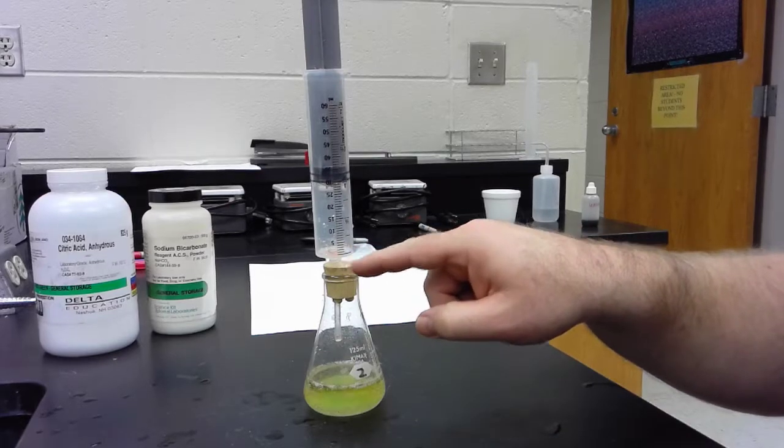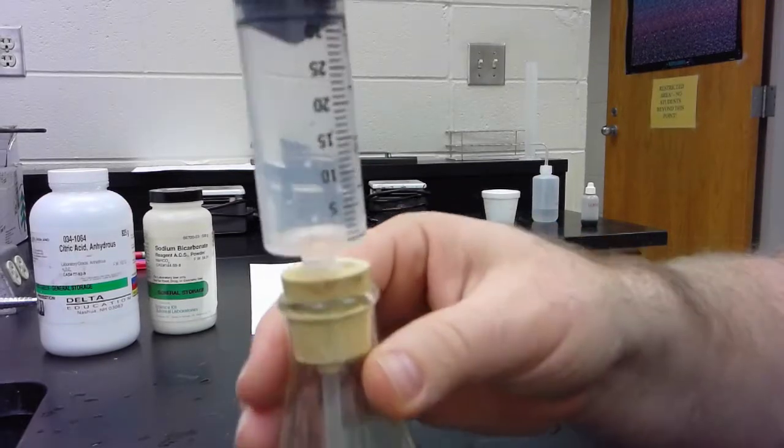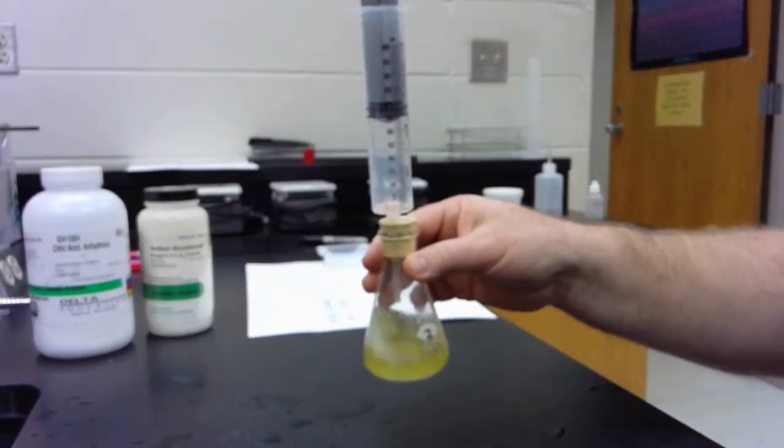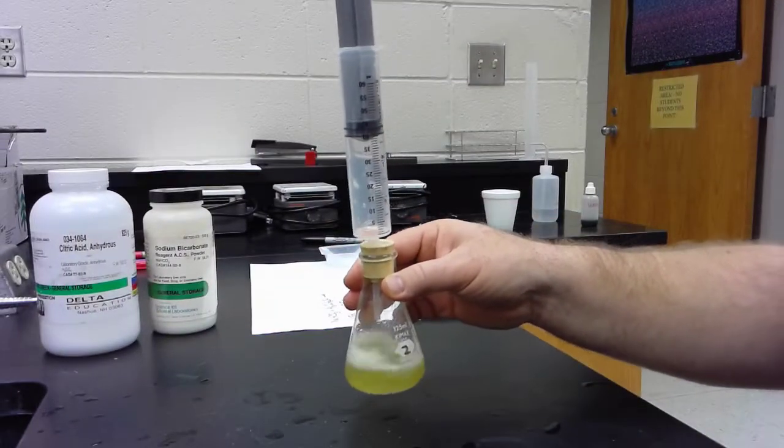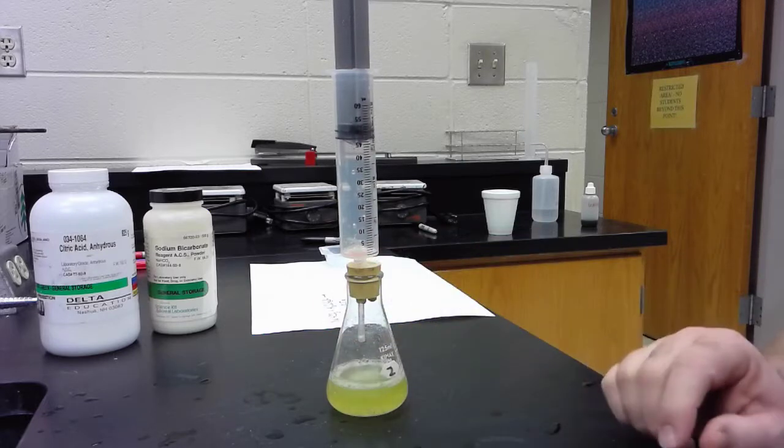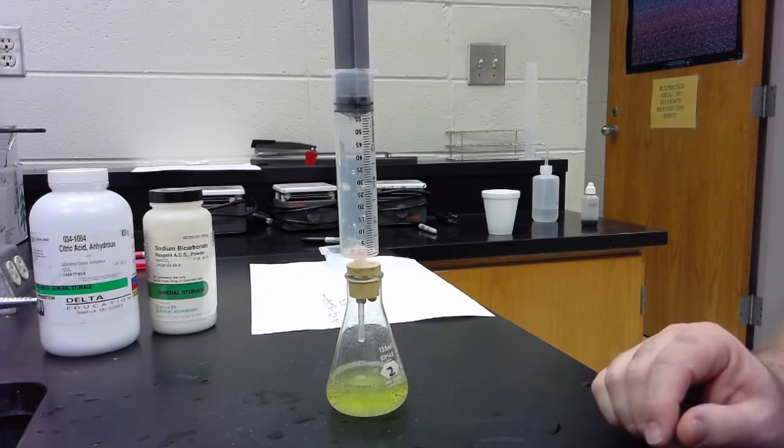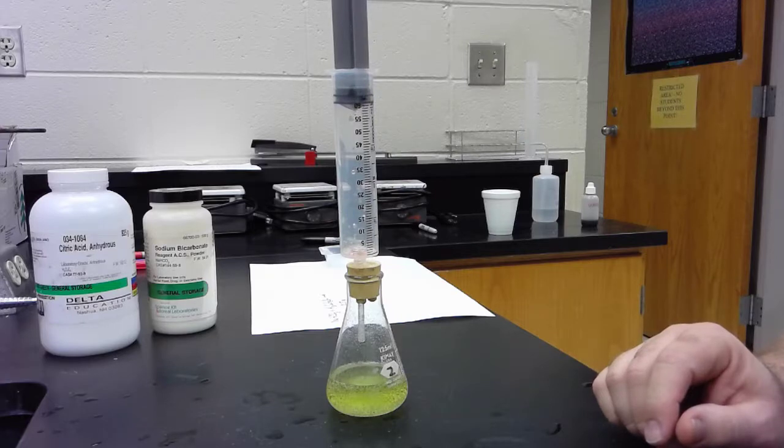I can see it's a little bit red here as it bubbles up into the syringe just a little bit. Make sure everything gets in good contact. Some good bubbles going. Oh, we're about to pop the lid off of the syringe. We've passed 60 milliliters.